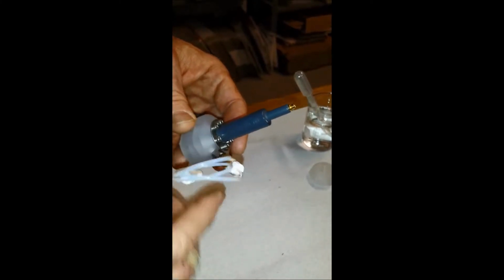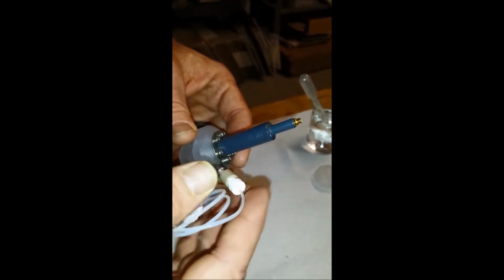How to disassemble an amperometric flowcell. First, you turn off the pump and disconnect the wires and remove the amperometric flowcell from the system.